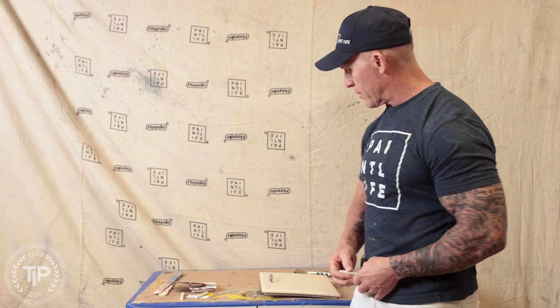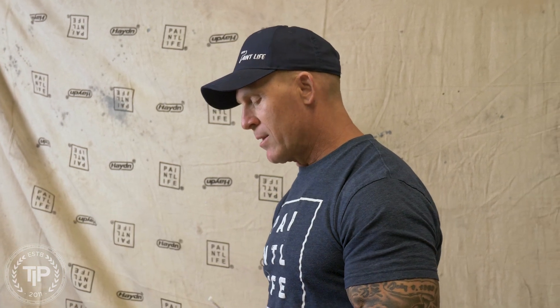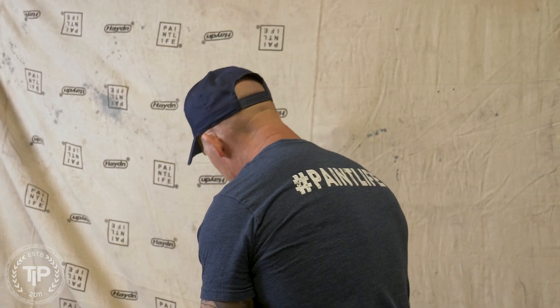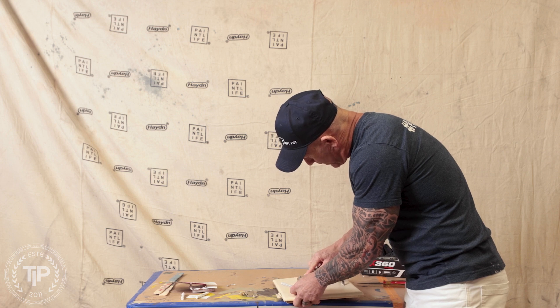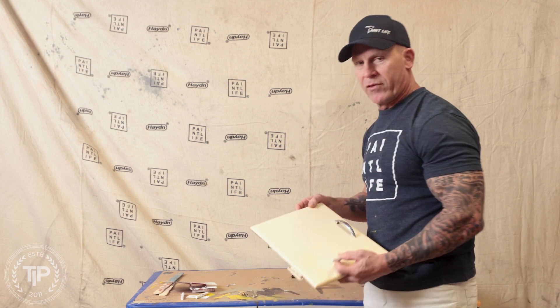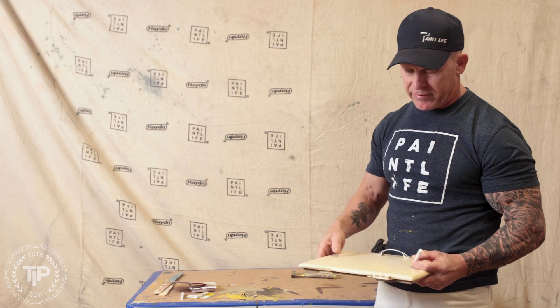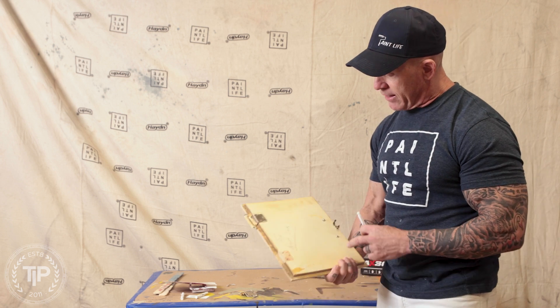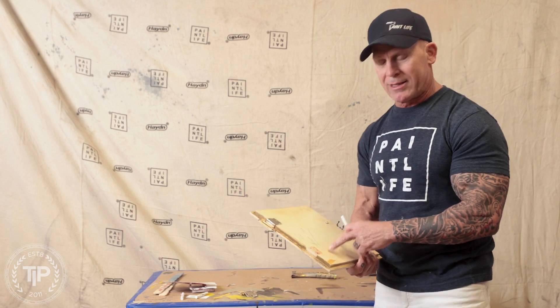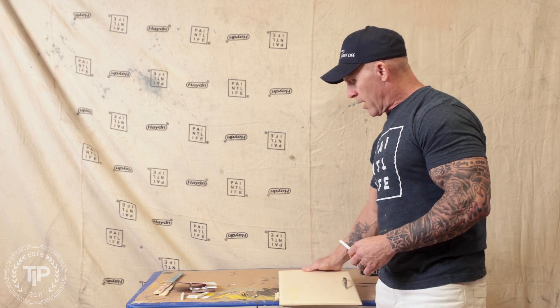There's an A and B port where you press to crush the vials. I've got a cabinet door here — this is one side of our duplex. I'm going to make a scratch and cut through multiple layers of paint. I can see a white layer, a green layer, a mustard layer, and an off-white layer. I've removed a hinge to test around there, and it's pretty close to bare wood, if not bare wood.